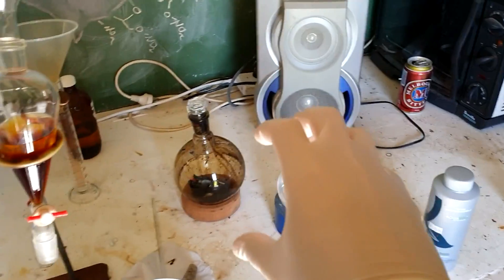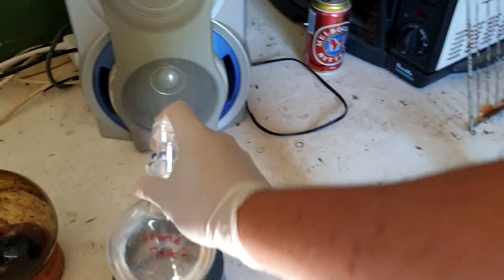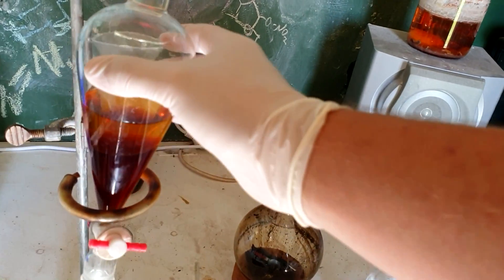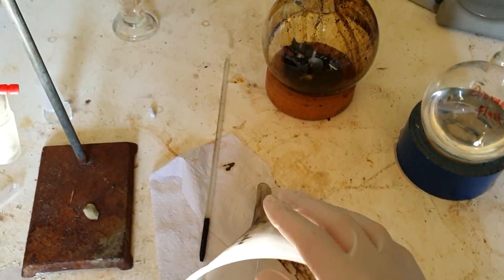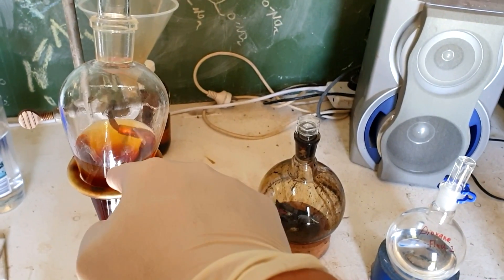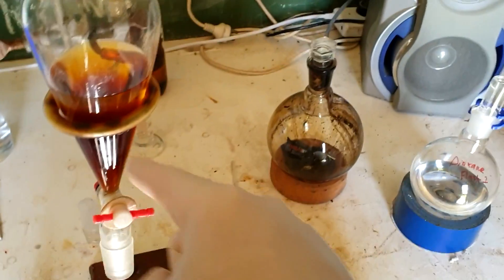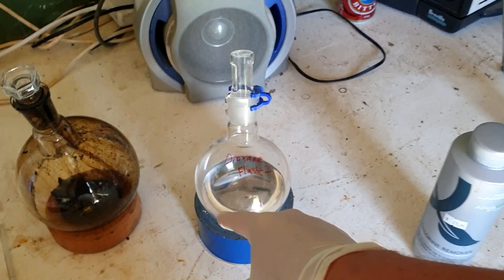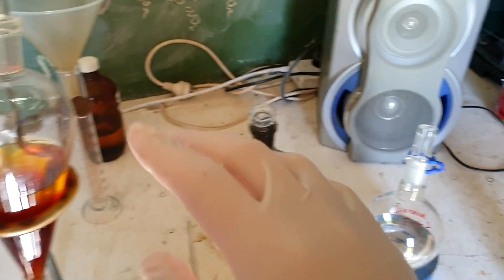Anyway, where are we at? We have a lot of dirty glassware which I still haven't cleaned — sue me. This is our nice dioxane from the last video, so we distilled it. It's above the azeotrope. We also have a small amount up here — that top layer of more crude dioxane recovered from our second round of distillation once we worked out the thermometer was cactus. To get this dioxane to the same level I have to run another distillation and combine the two, but maybe I'll just remove the aqueous layer and combine these two fractions. There shouldn't be heaps of water in this layer, and it's going to be wet anyway — it'll go yellow, but all chemistry goes yellow in the end. Chemistry is the devil's work and yellow is the devil's color.